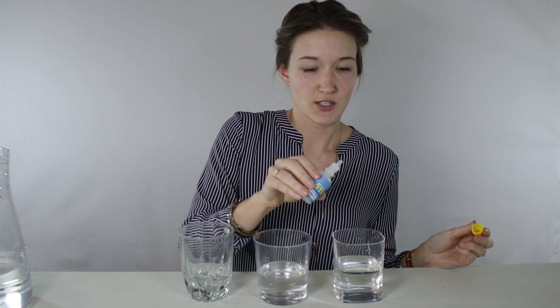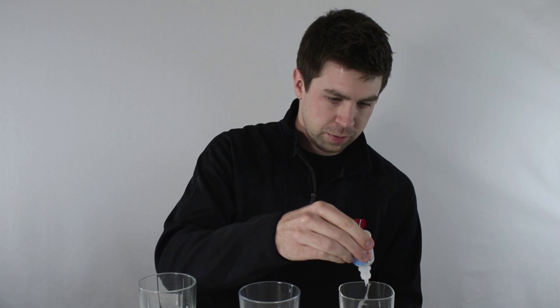Don't turn yellow. Alright. So this chemical here is just going to detect chlorine in the water — put 10 drops. One, two, three. So the yellow is going to be the indicator of chlorine.